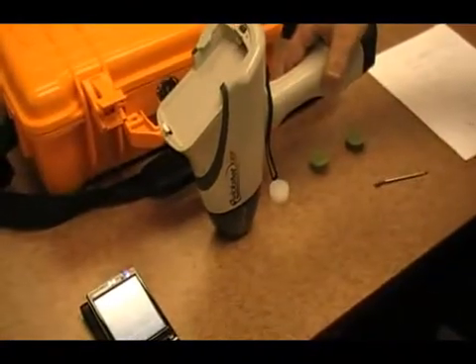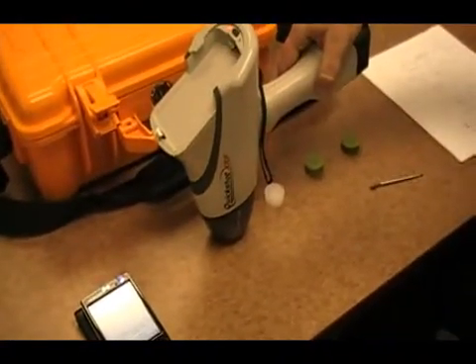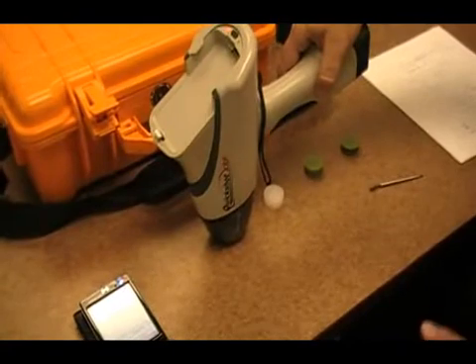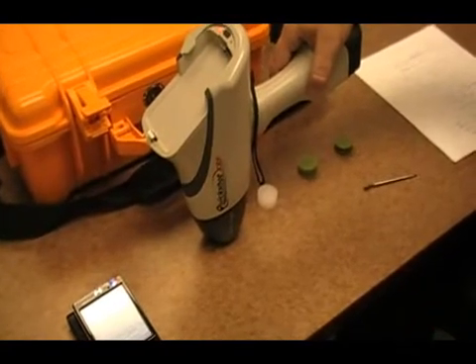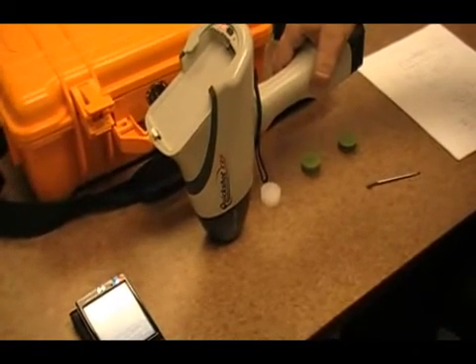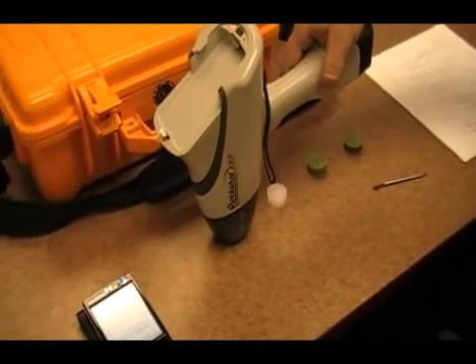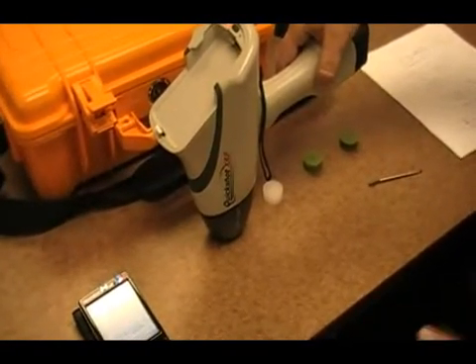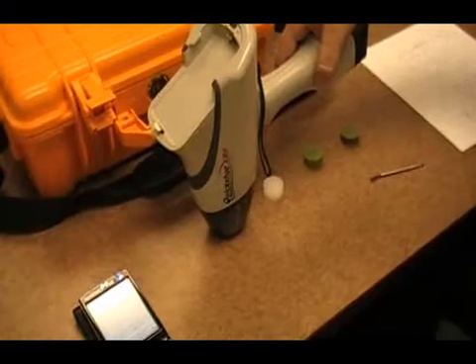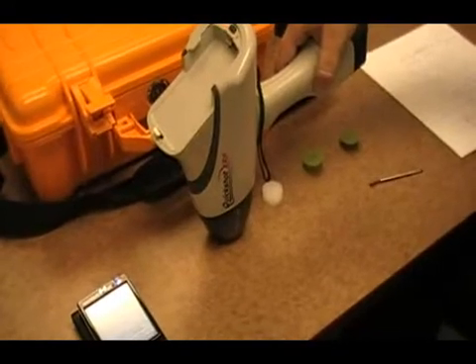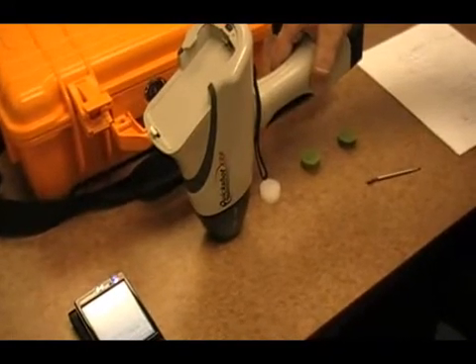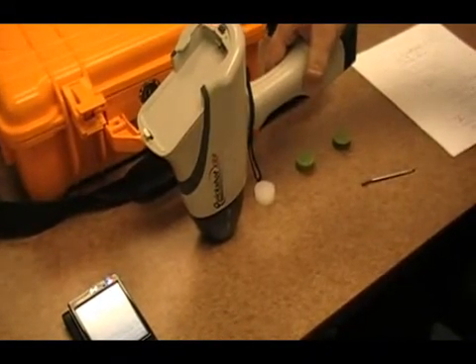It then takes approximately 15 seconds to register that the silver is there, and then it will do the initialization. So we will wait for it.